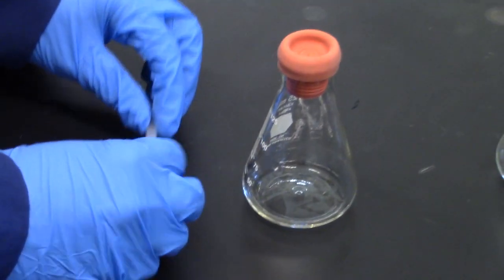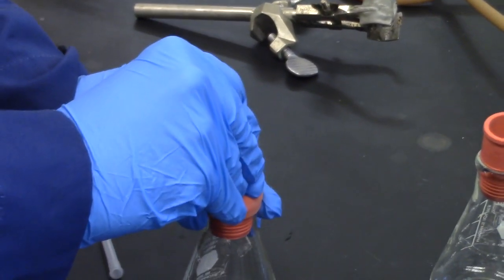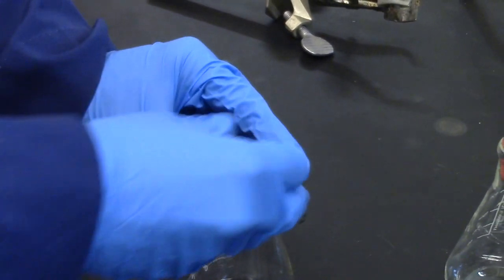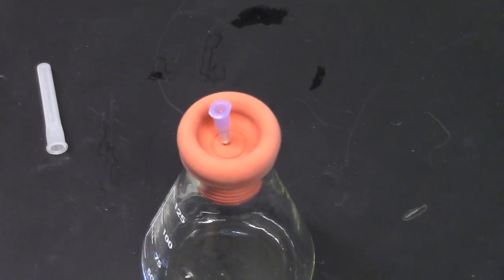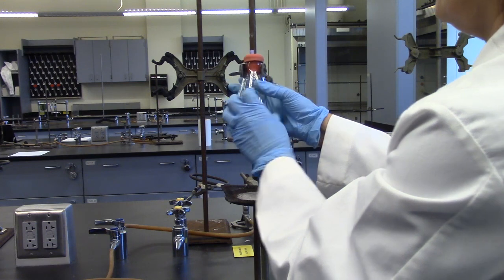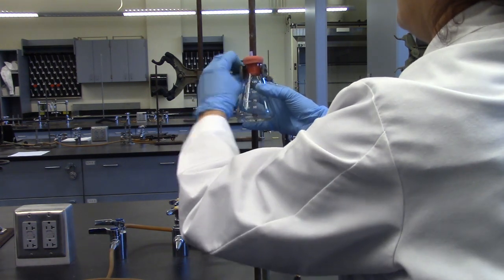Place a small piece of disposable needle through the puncture in the septum to allow the air and excess vapor to escape when the flask is heated. Clamp the flask at an angle so that you can see the liquid collect at the bottom. Make sure to use longer clamps if possible.